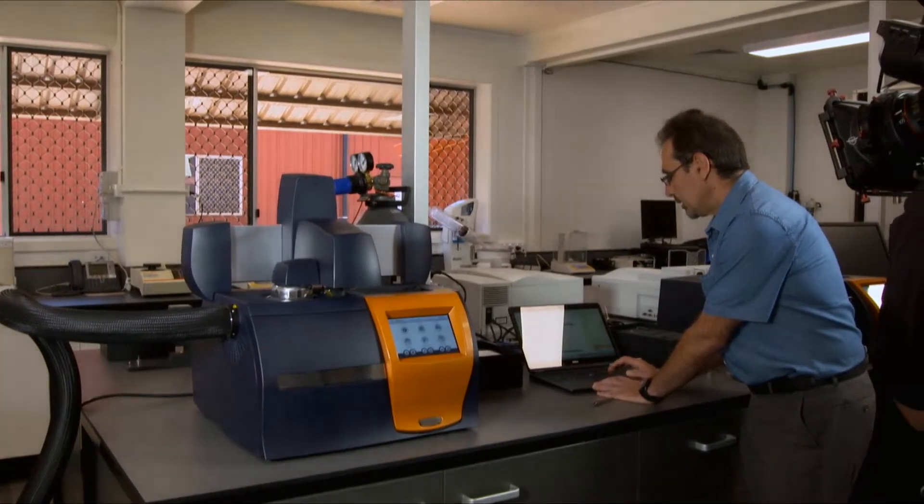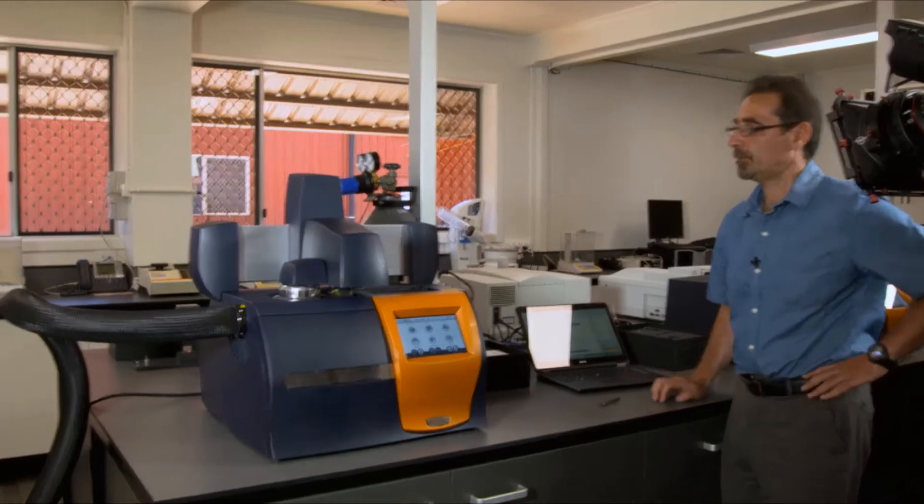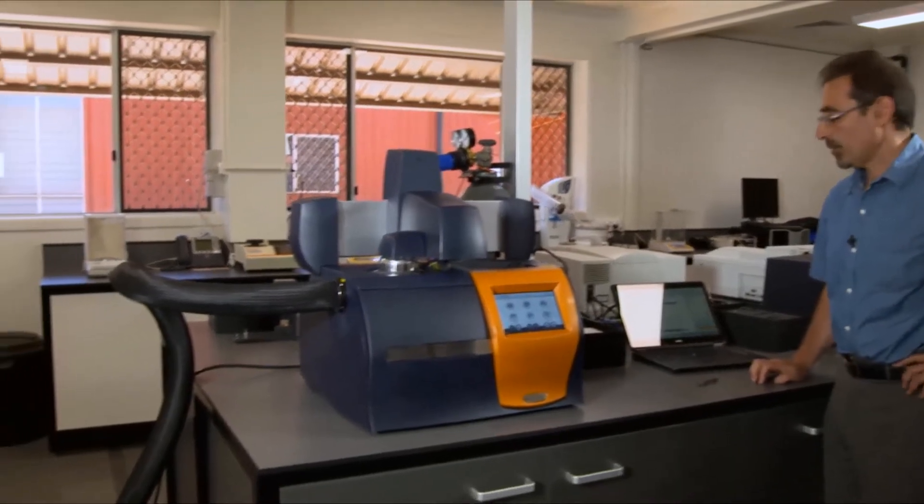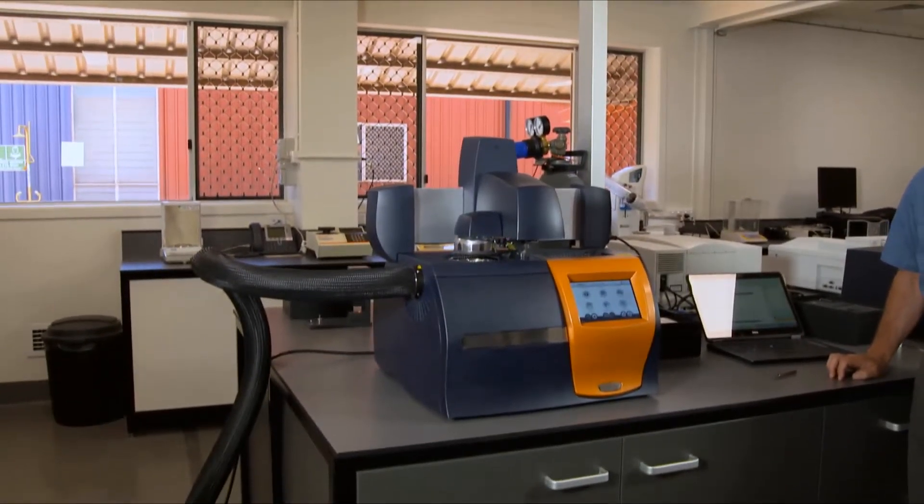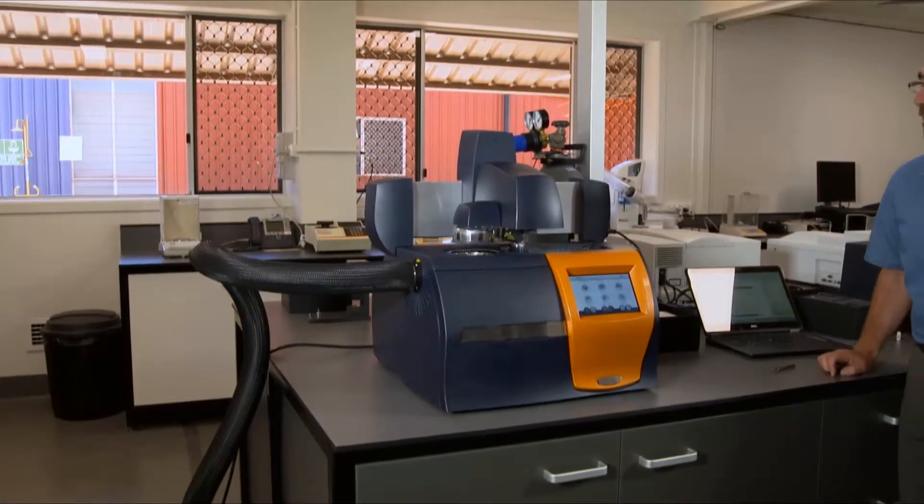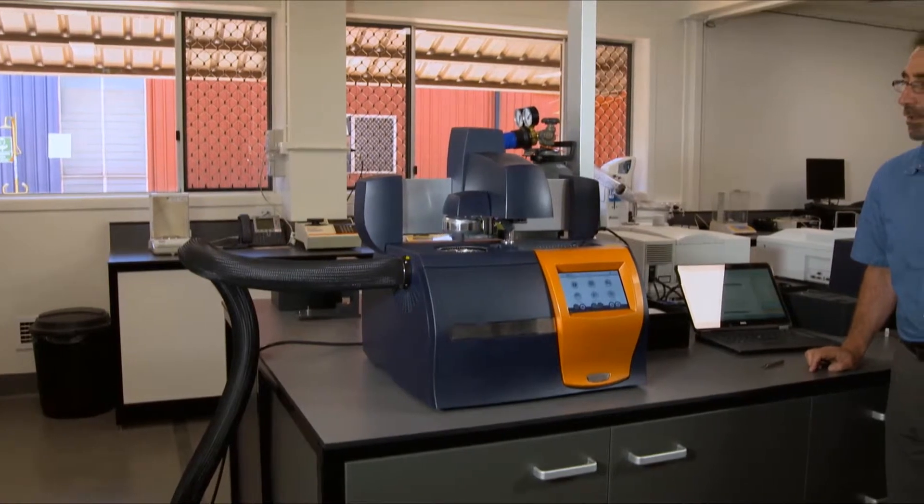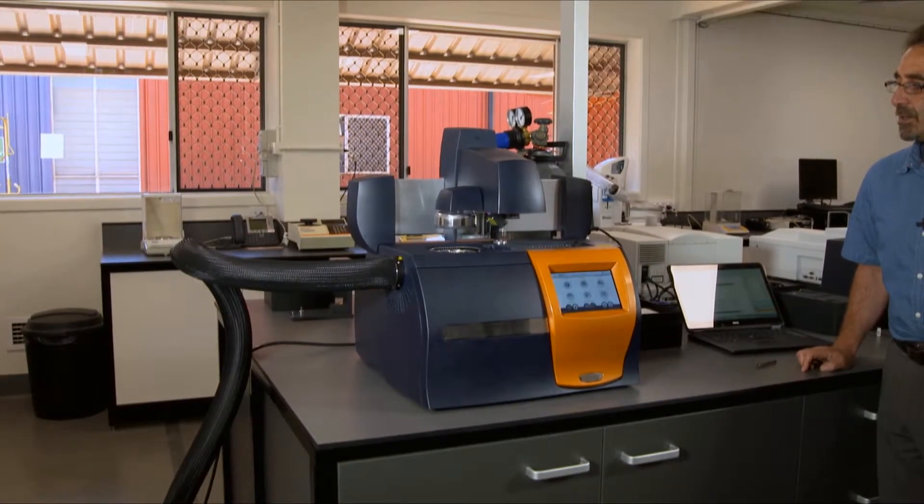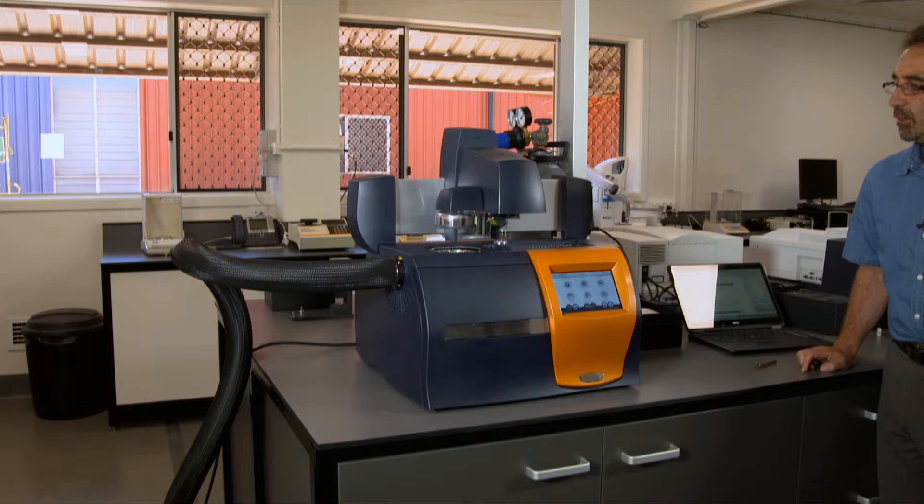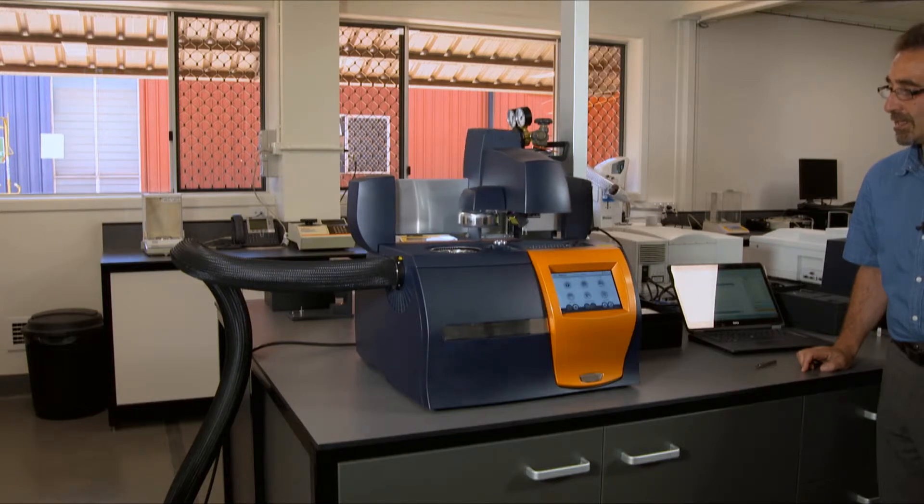Start. So you can observe that the instrument will pick up a pan from position one, then four, put it in an appropriate position in a cell, and the run will start.